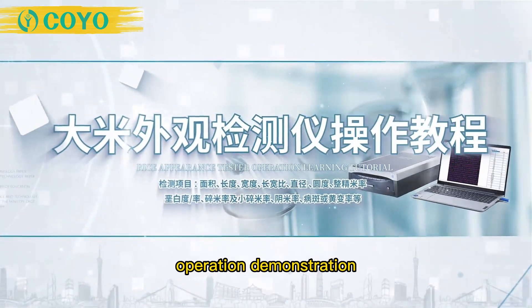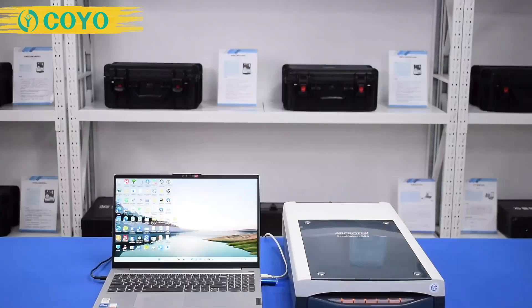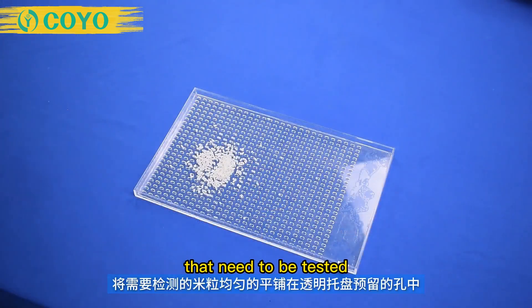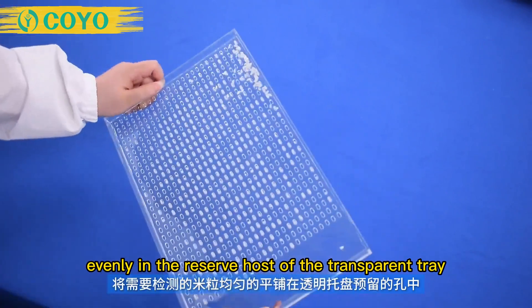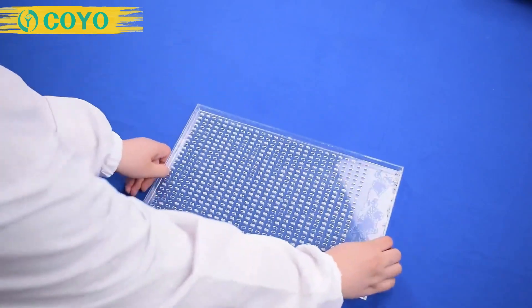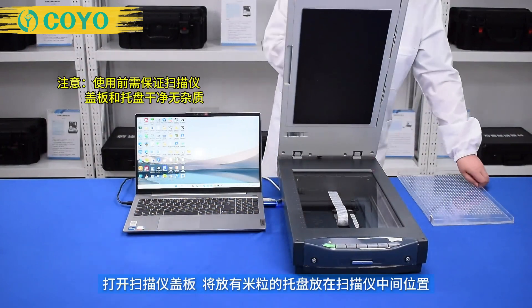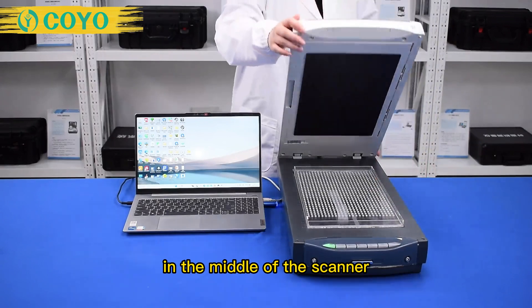Operation Demonstration. Spread the rice grains that need to be tested evenly in the reserved area of the transparent tray. Open the scanner cover, then place the tray with rice grains in the middle of the scanner.